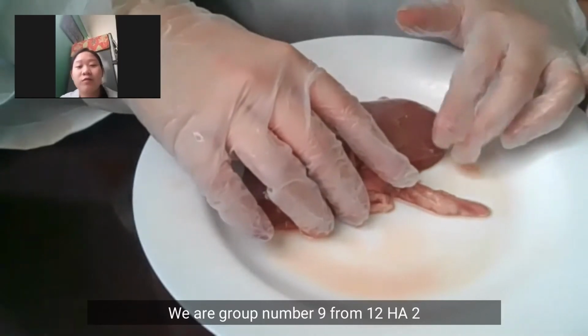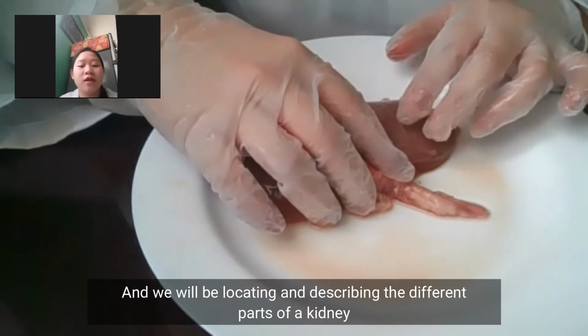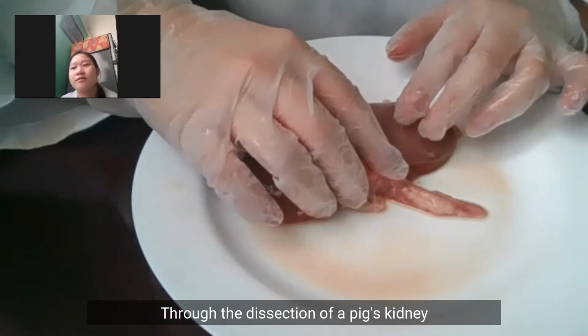We are group number 9 from 12HA2 and we will be locating and describing the different parts of the kidney through dissection of a pig's kidney.